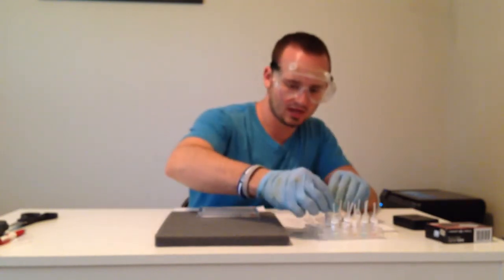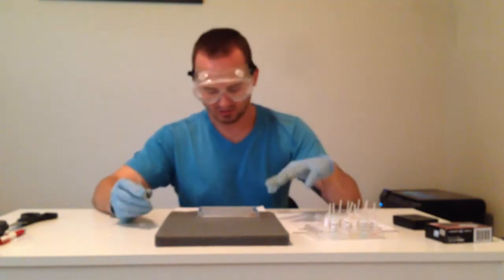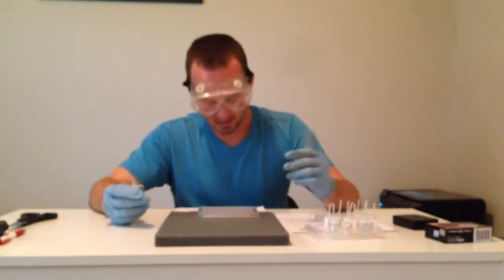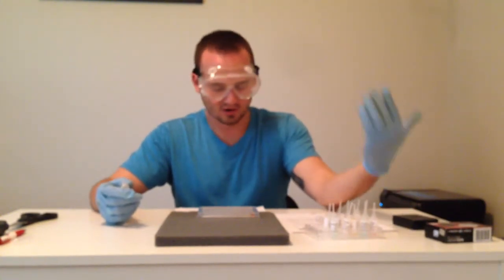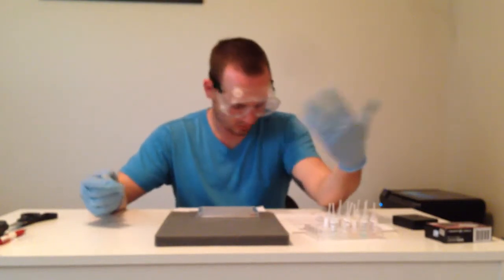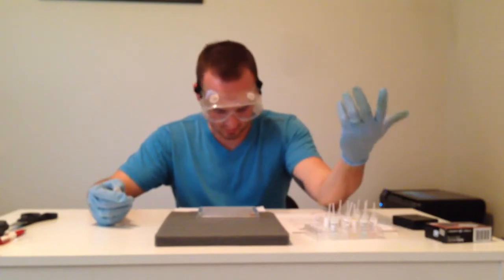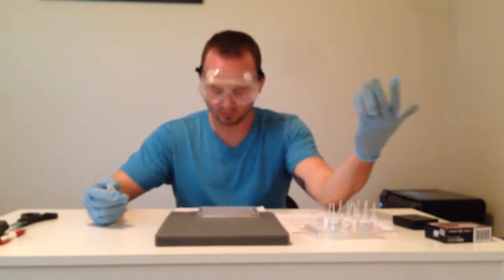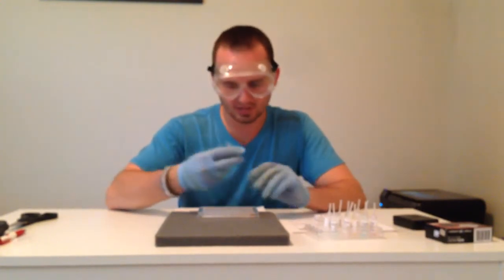And I'm going to put that in our well over here, making sure we keep it in order, because some of these precipitates might take a little bit of time to form, so we always want to be able to go back and look. This was, for instance, our D row and our 3rd column, so that would correlate with something like barium 2 nitrate mixed with sodium chloride, or something similar to that. And I'm going to go ahead and move on to the next one.